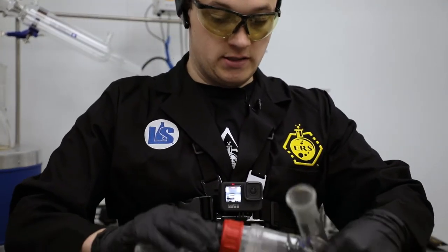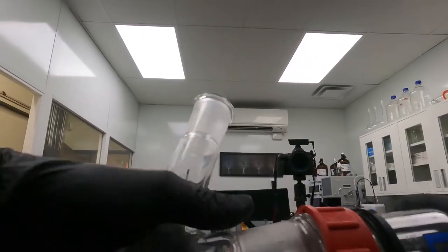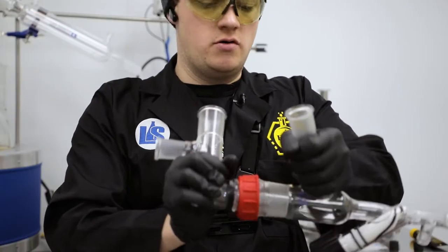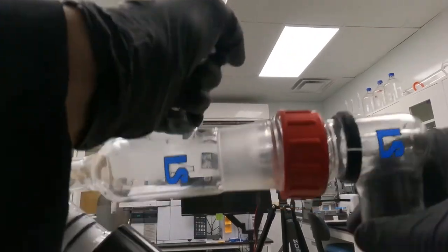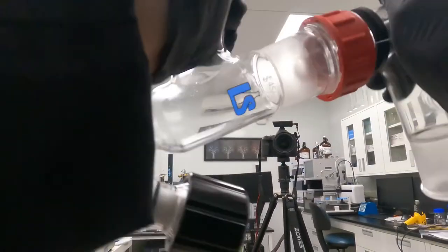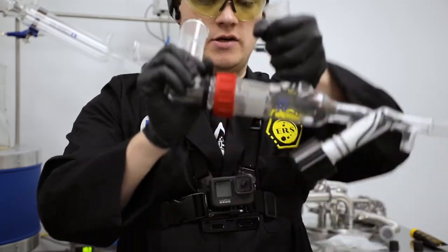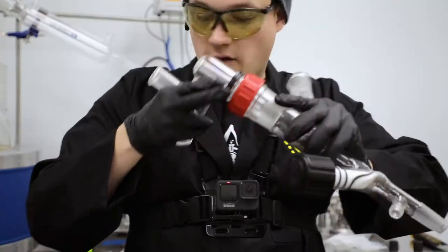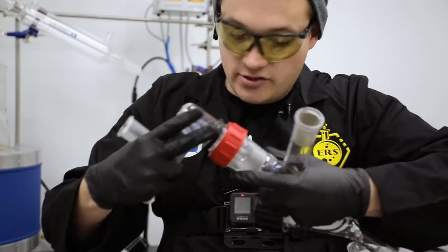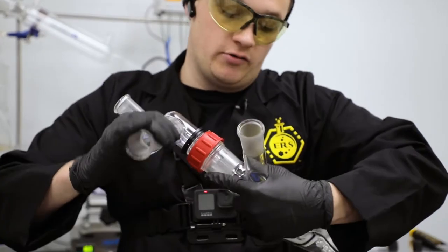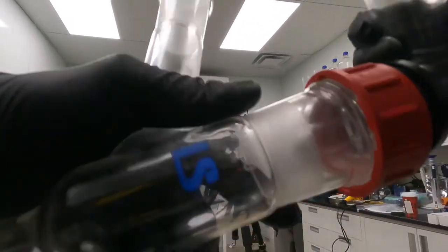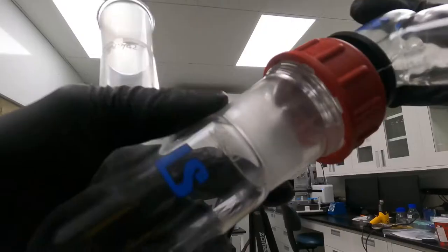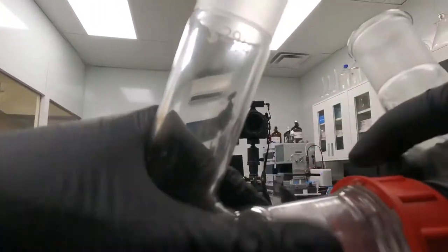I'm going to go ahead and insert this into the female Rotavis side and then, utilizing minimal force, I'm going to rotate these two pieces along the axis that the joints attach to, to get the grease spread nicely up inside. I want to listen for scratching sounds. If I hear scratching that could mean that the grease is not spread enough yet or there's not enough grease. And while I'm doing this I'm applying slight pressure this way just to get the joint nicely seated.